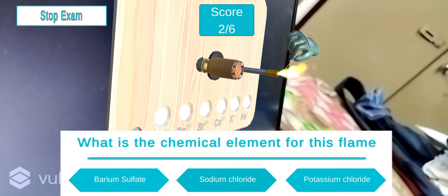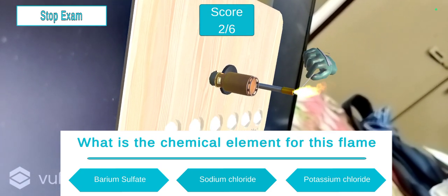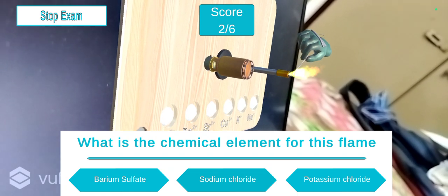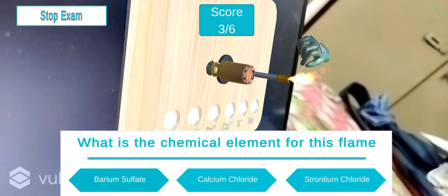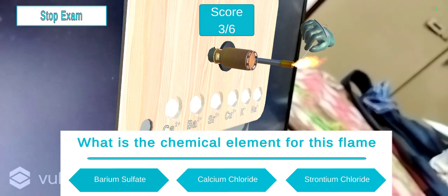What is the element for this flame? Is it barium sulfate, sodium chloride, or potassium chloride? You can see light green, so maybe it's barium sulfate. Yeah, it's correct. When you move further to your fourth question, what is the chemical element for this flame? If you just type strontium chloride, some wrong answer or something.